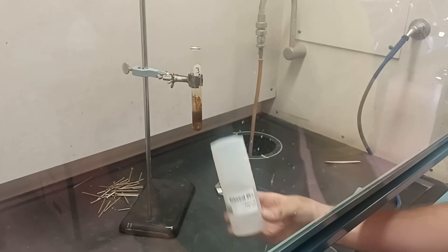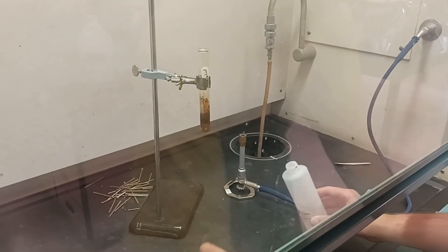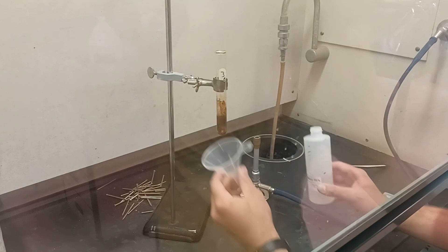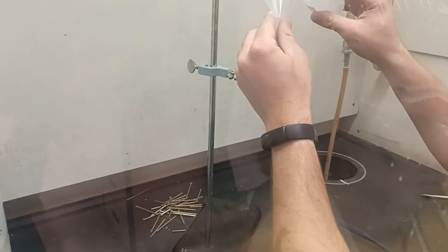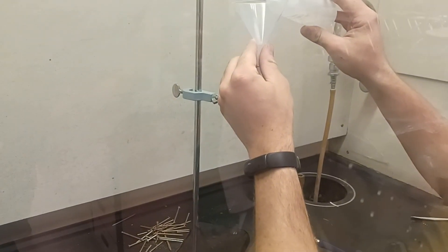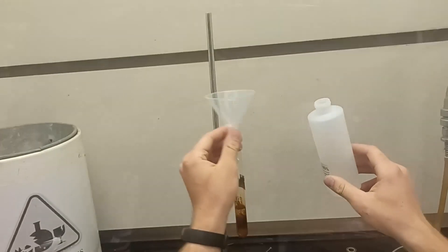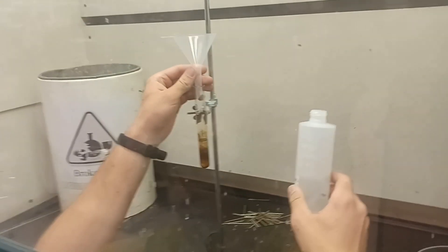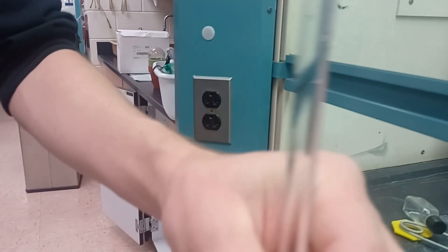A couple of mils of high concentration ethanol is then added to the test tube, because cadaverine is highly soluble in it whereas other potential remaining products in the test tube are not. The mixture is then stirred with a long stir rod in order to ensure all of the cadaverine is dissolved.